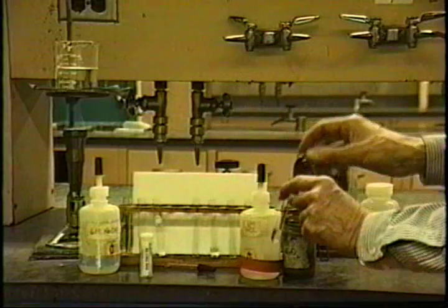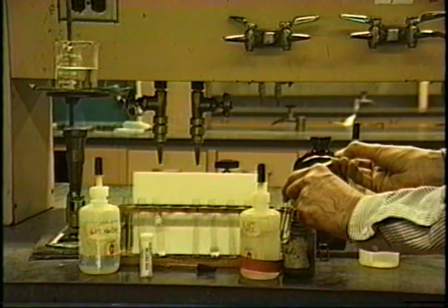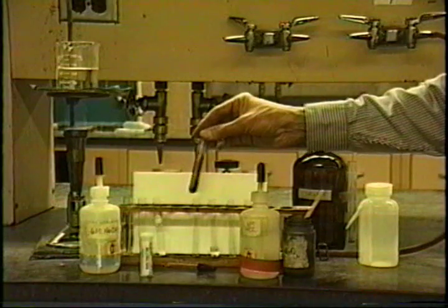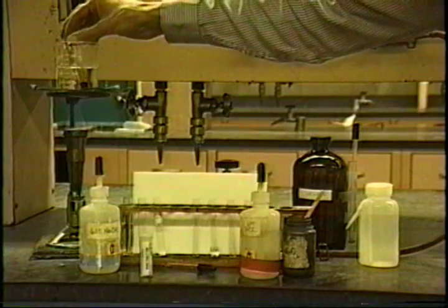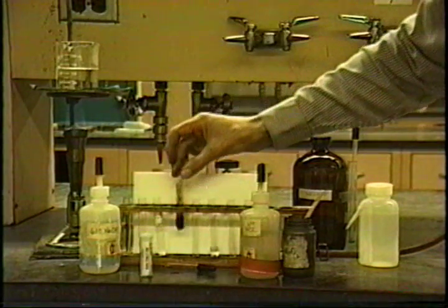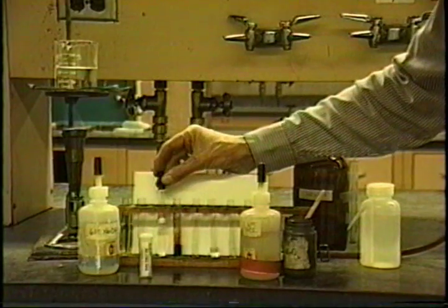All right, next step then. Apparently there's nothing much in the line of CO2, SO2, nitric oxide, or H2S. We put the manganese dioxide in here. Oh wow, it's really turned dark orange at this point. And let's just heat that up a little bit. Oh, there's a purple vapor there. Oh, we pretty well know what it is at this point. But nevertheless, let's continue the analysis so that we know we haven't made a mistake.